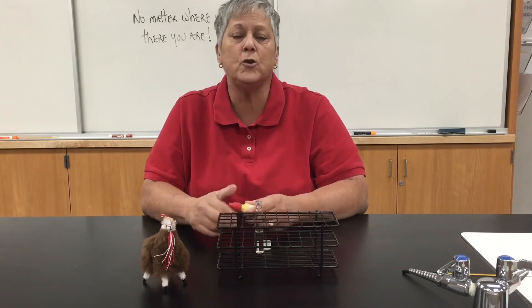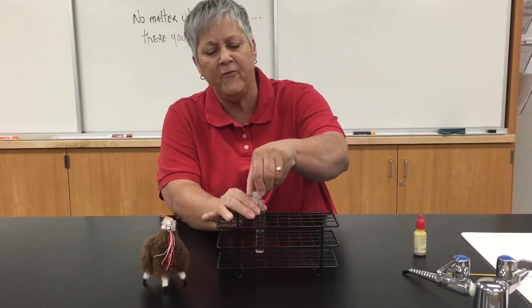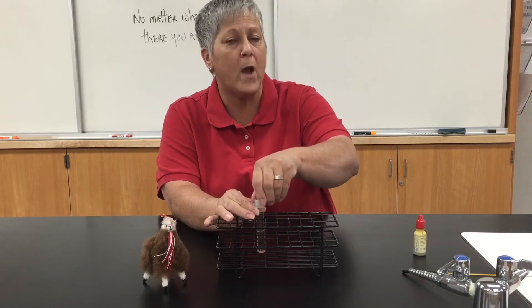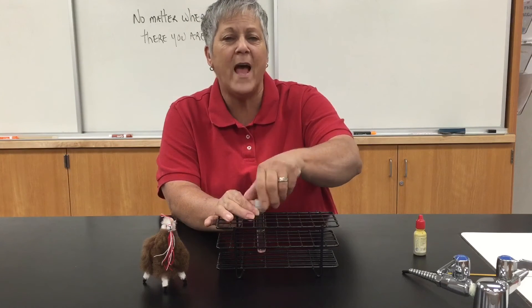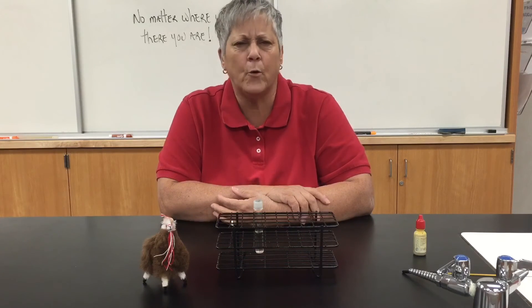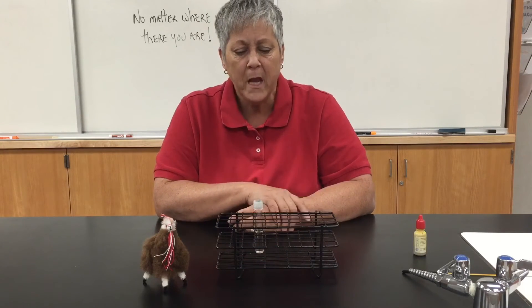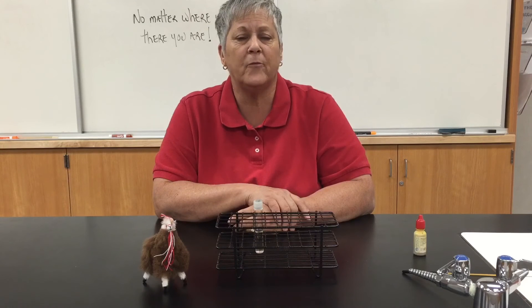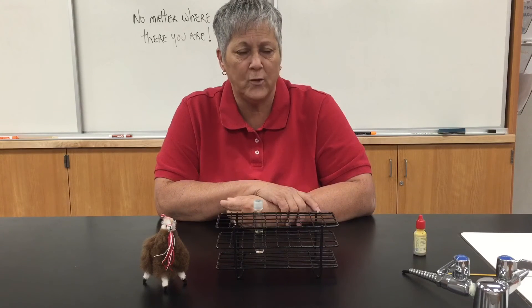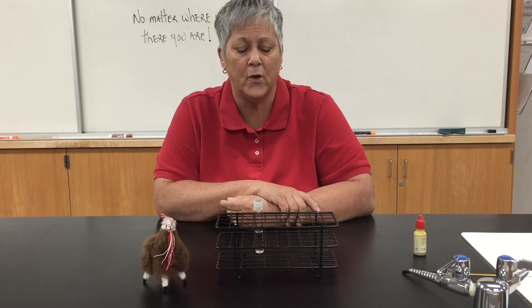The reaction should occur pretty quickly. If that Kovacs layer turns red, that's a positive reaction. If it's brown or yellow, that would be a negative reaction. I will insert a photograph showing a positive and a negative reaction for you.